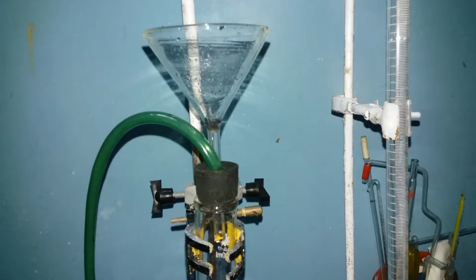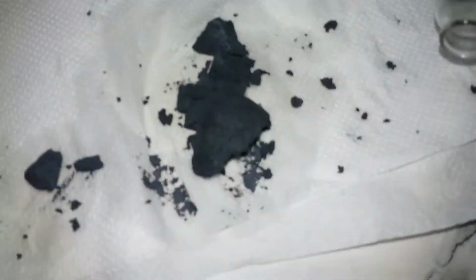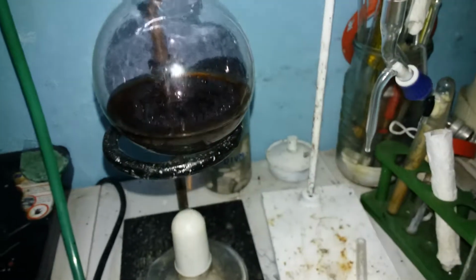We're gonna dry it off on this, and then we're gonna weigh the end amount. We'll try to extract from this too. Okay. Now here we have more of the solids, and wow, just cool. Okay, so now it's still wet, so what we're gonna do, actually what I like to do is, why doesn't it focus?